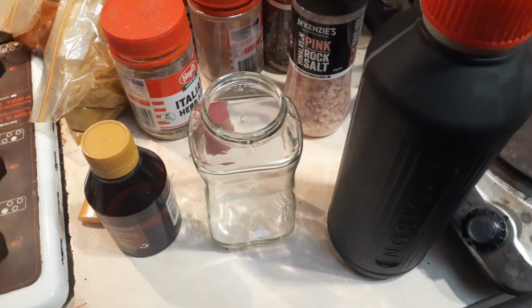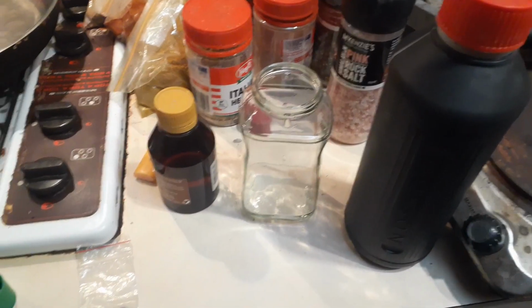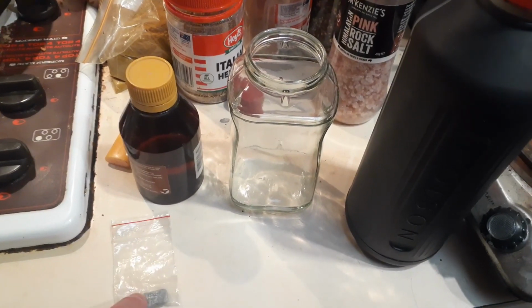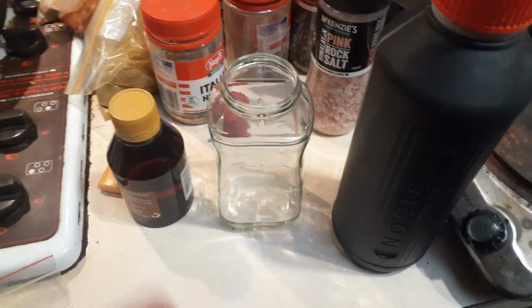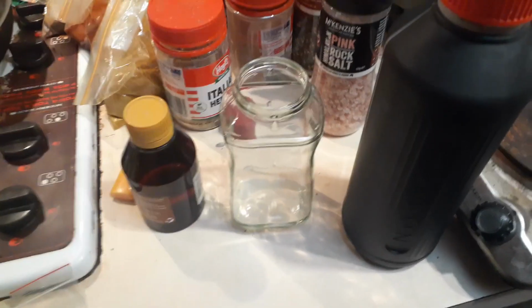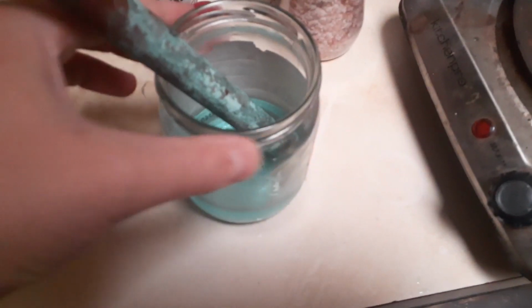So you can also do it with probably an iron sulfate. The other ingredient, as you can see there, is hydrochloric acid, and a hydrogen peroxide. I use 3%, 6% also works. Specifically, you do not want to use vinegar and peroxide.